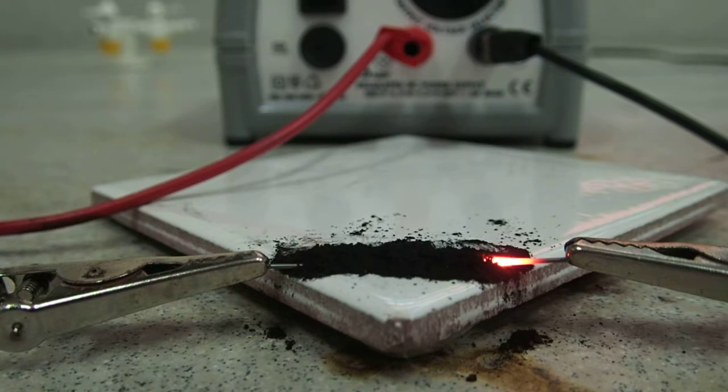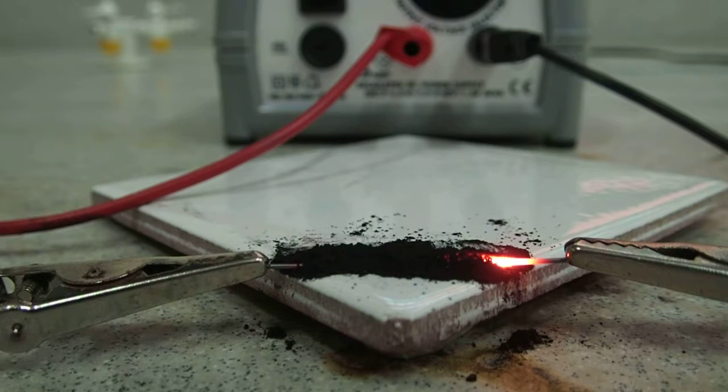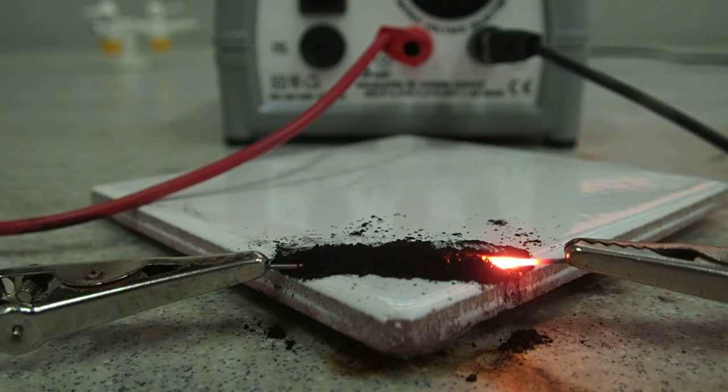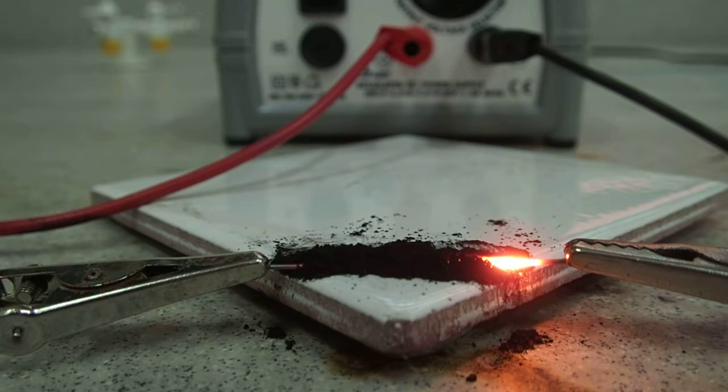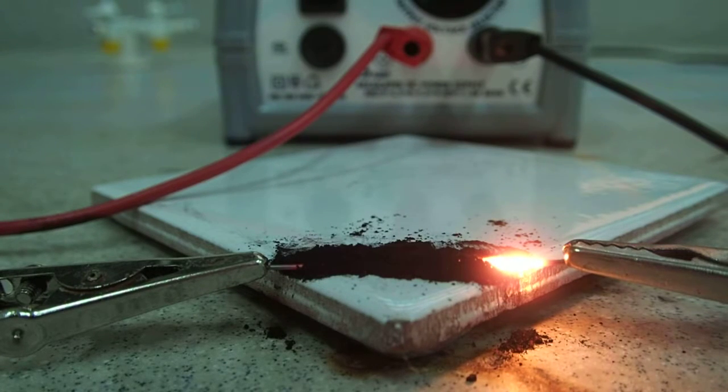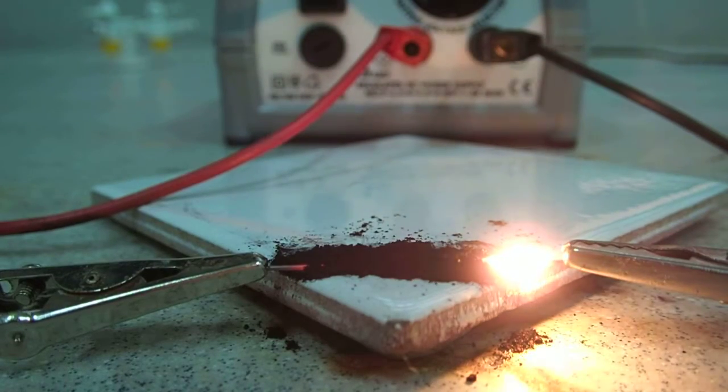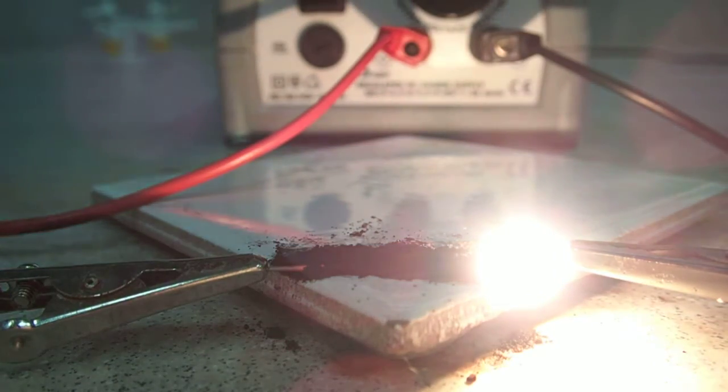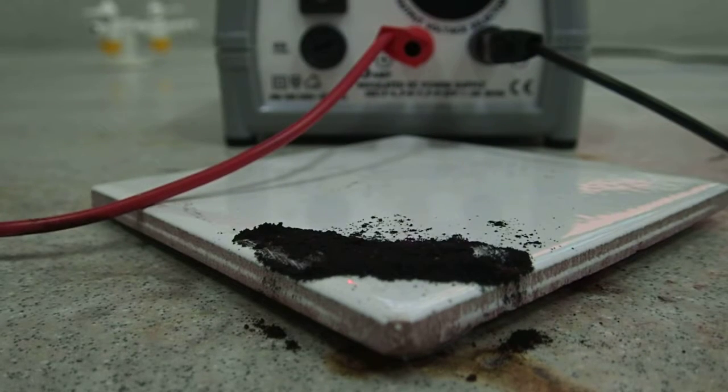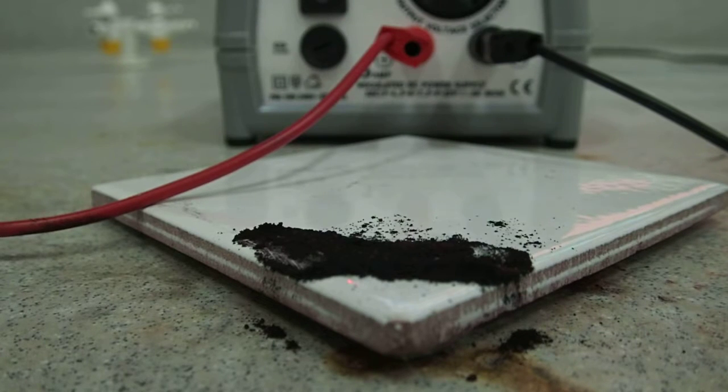We'll let this one go through to completion and see if we observe anything by way of a chemical reaction. Then turn off the power, remove the two electrodes. This should cool down quite quickly because it's on such a small scale.